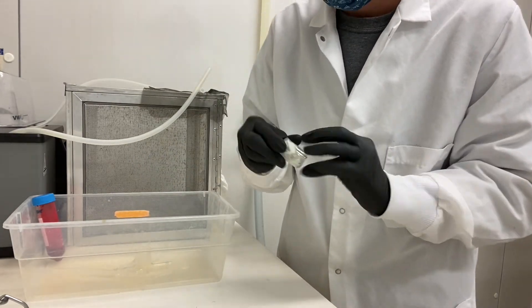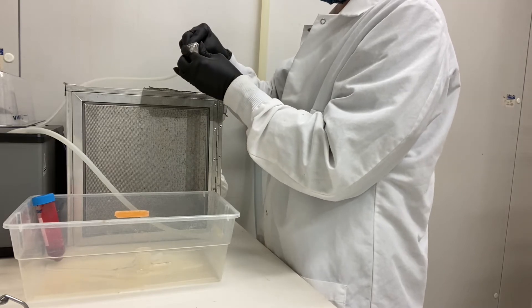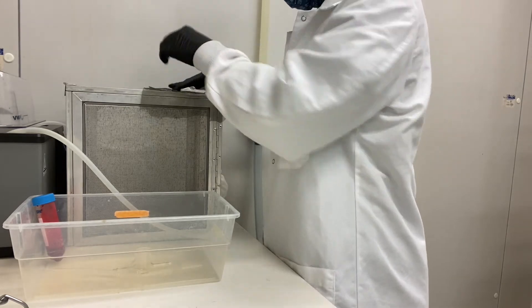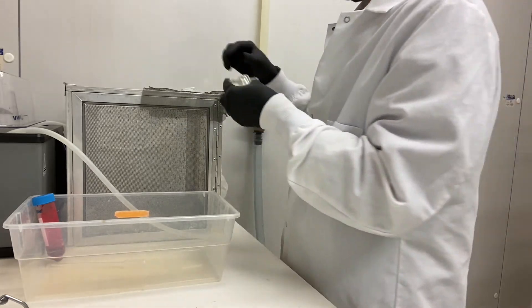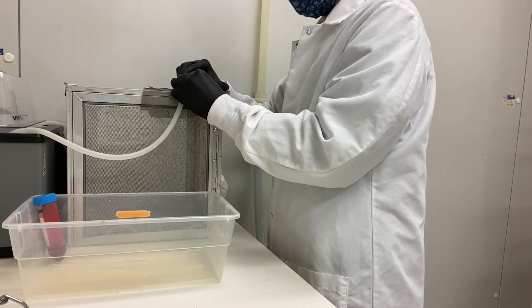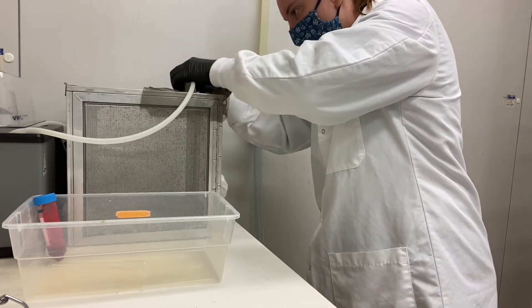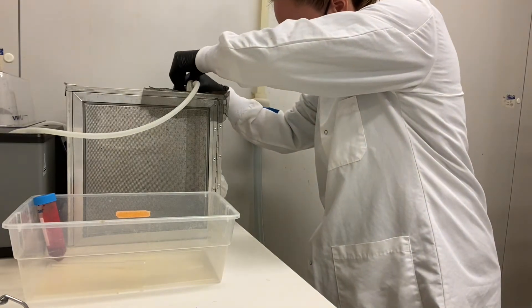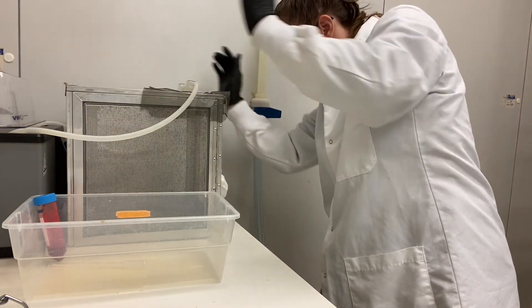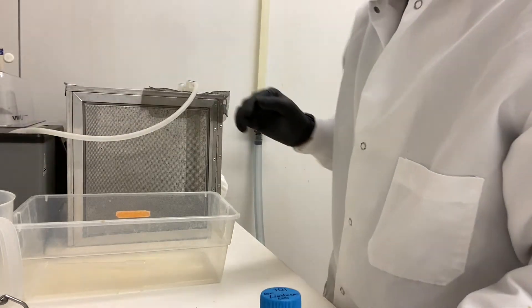Check the seal again to make sure everything is pressed down enough. Hook up one end, get your smaller piece of tubing on the other end. Check the seal on this one, attach it. The water circuit runs through the long tube and out the other end. Make sure the crucibles are sitting so they have good contact with the netting so the mosquitoes can get a good feed — you may have to adjust them a little. Then plug in the pump to make sure the water flows through them.